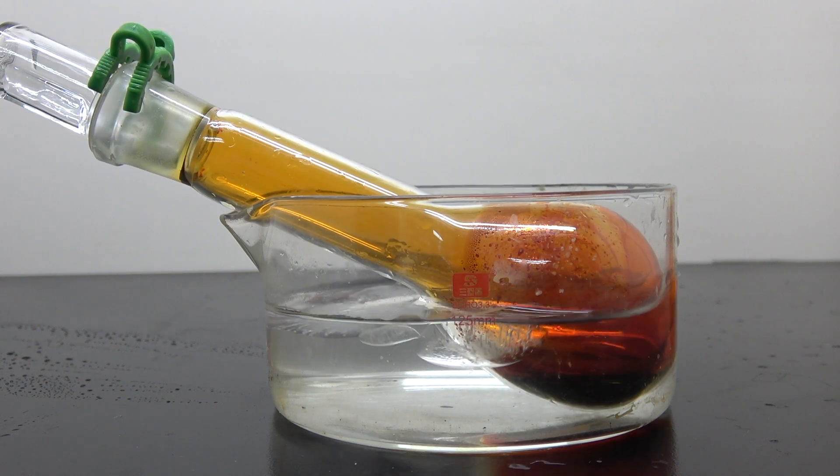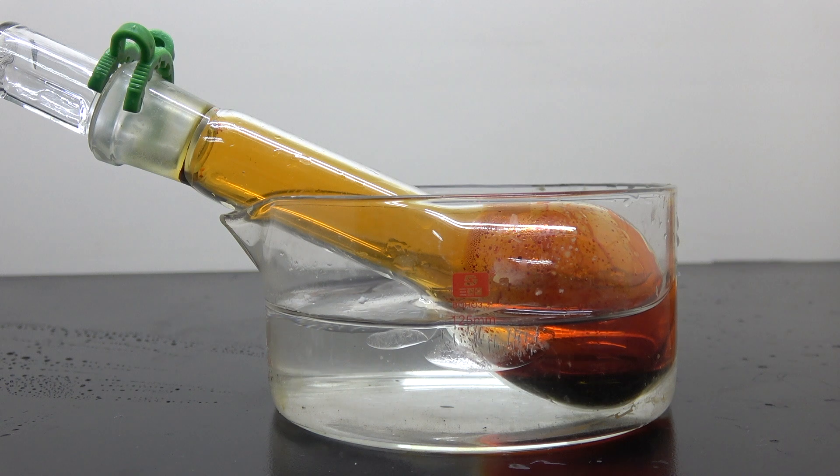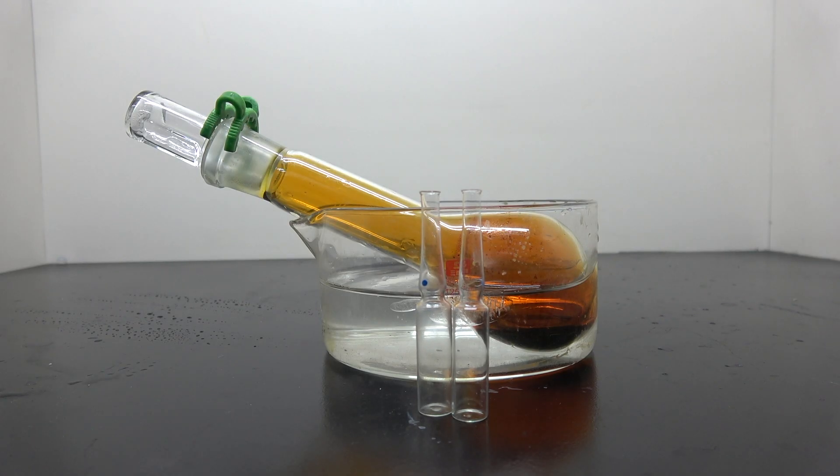Bromine is extremely volatile. It will leak through nearly all types of containers, including the one you see here. The only way to store bromine for an extensive period of time is to ampoule it.